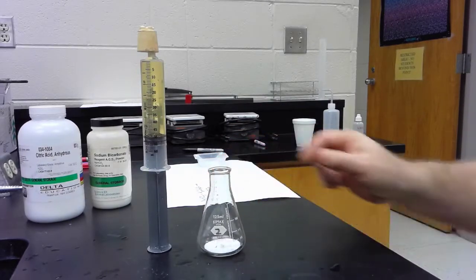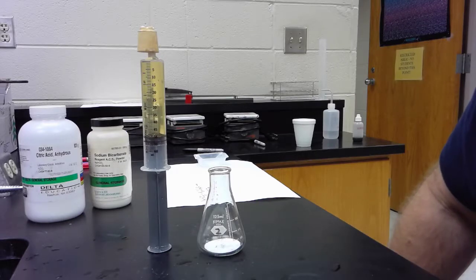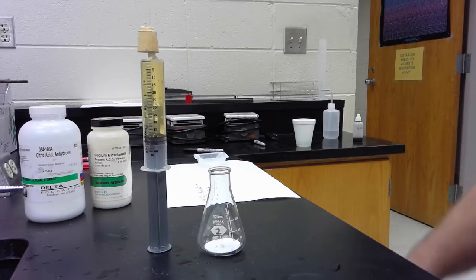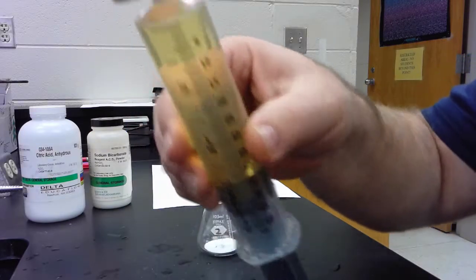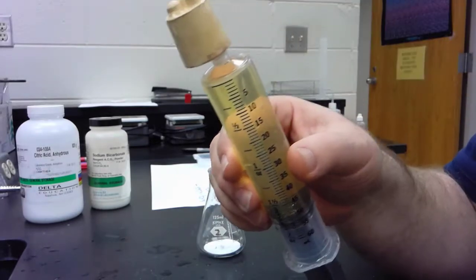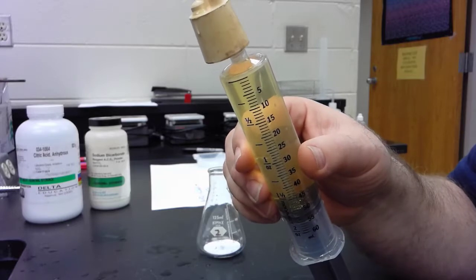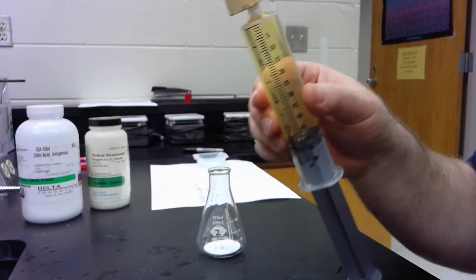Here we go. I'm hoping that we will form some gas and I'll be able to collect it in the syringe because of the setup. I've just taken a three-hole rubber stopper, put a plastic pipette through it, clipped off the ends and we're ready to go with that. So let's see what happens.